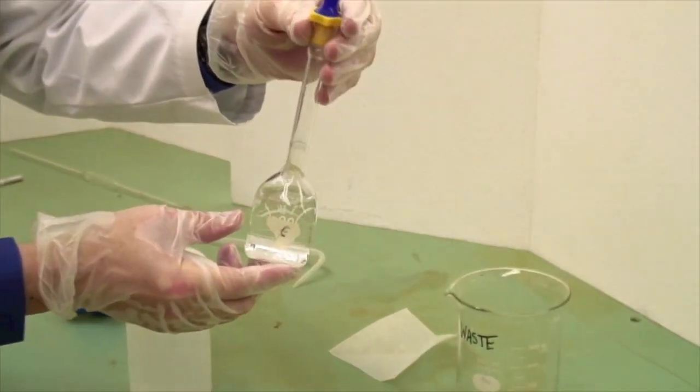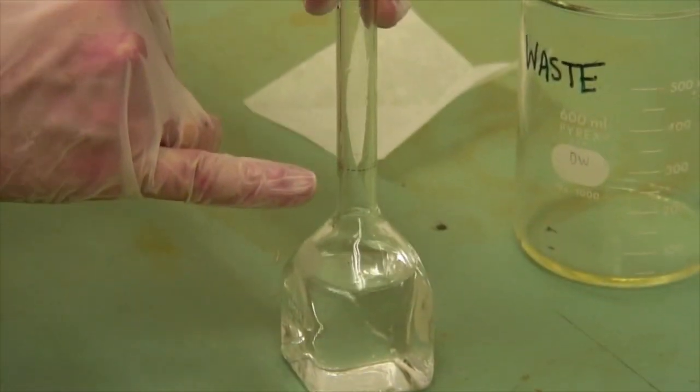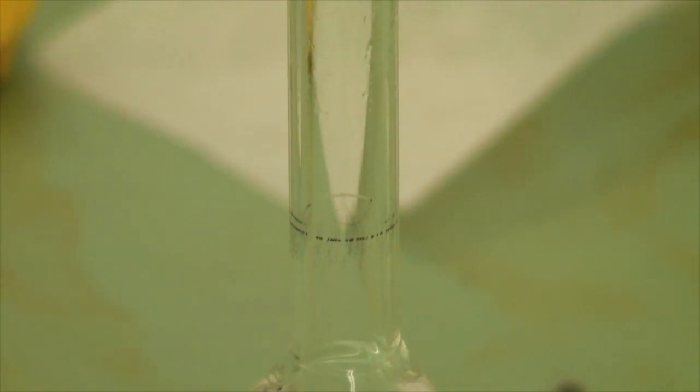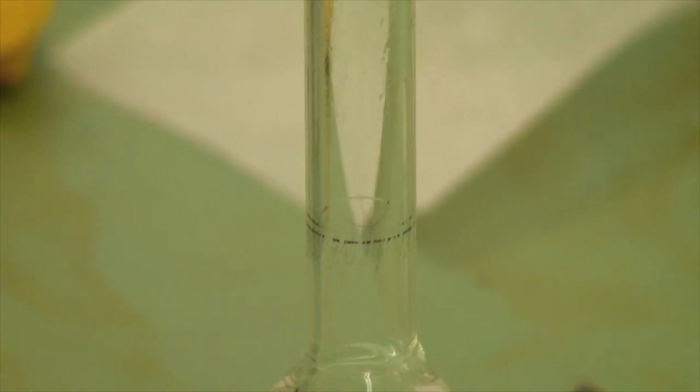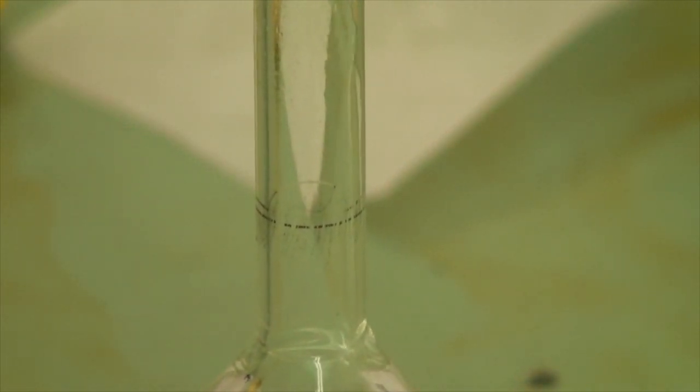Now, for the demonstration, I chose something that would dissolve quickly. Here is the calibration line. I think you can see it a little more clearly in this example. And so let's add enough water to get it close to the calibration line.